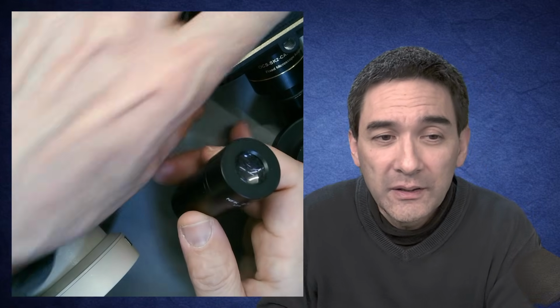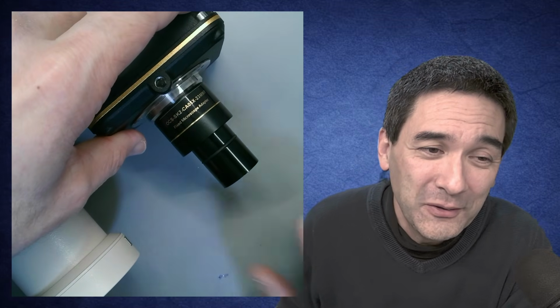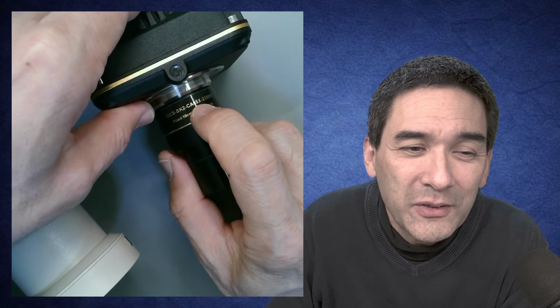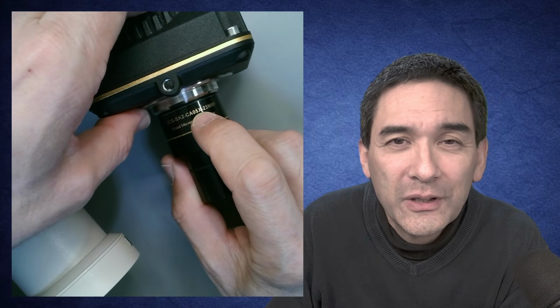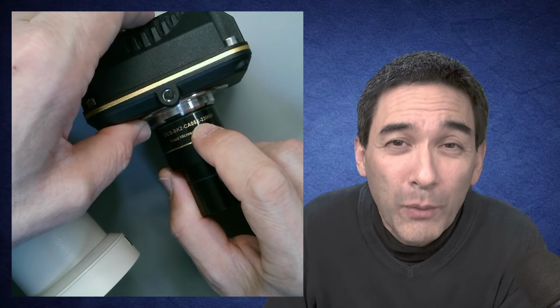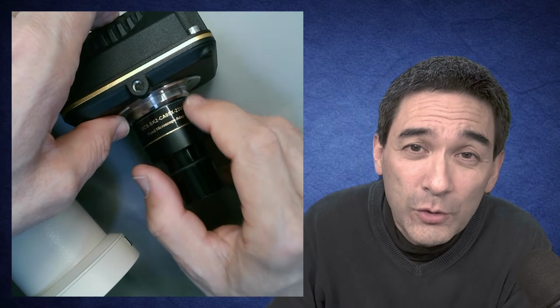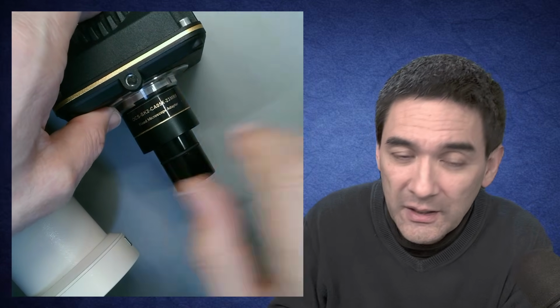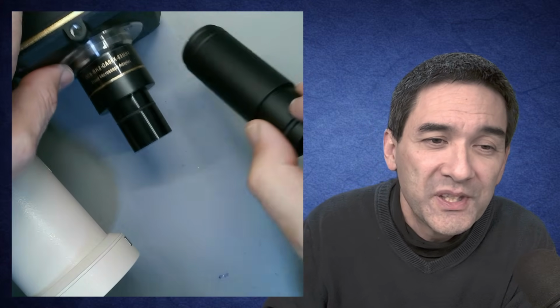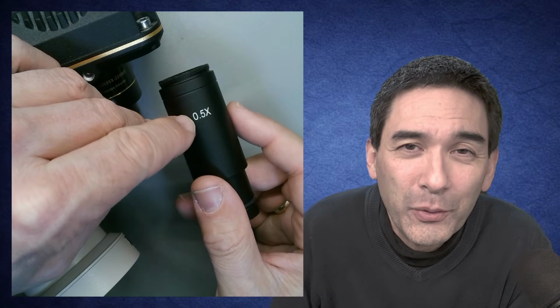Now let's have a look at the intermediate optics of one of those significantly smaller microscope cameras here. There's a long number over here, but there's a very tiny 0.5 written on it. So it actually does not make the image larger but smaller, it reduces the image. Sometimes, therefore, these optics are also known as reduction optics. I've got another one over here which I bought separately. It also has a magnification of, here it says, 0.5 times.